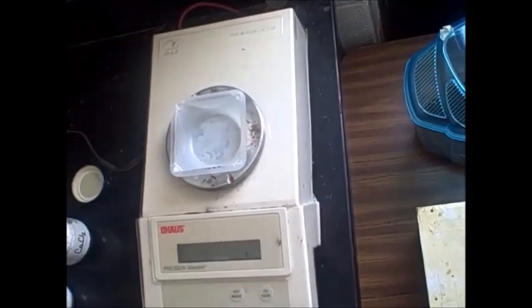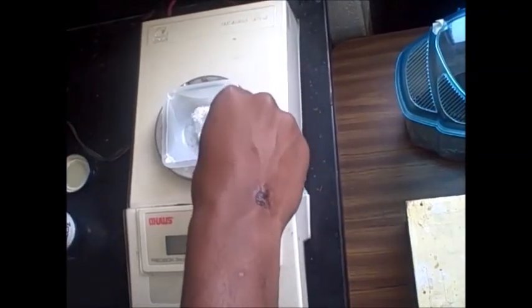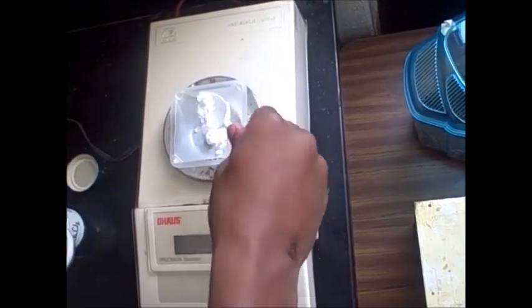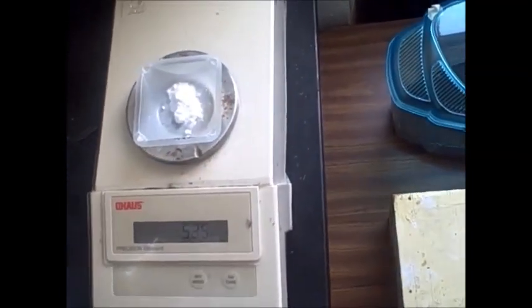Do you just pour and get... It's 5 to 7, so it doesn't matter. Try and get the 5, and if you go over, then you... I don't want to take too much.